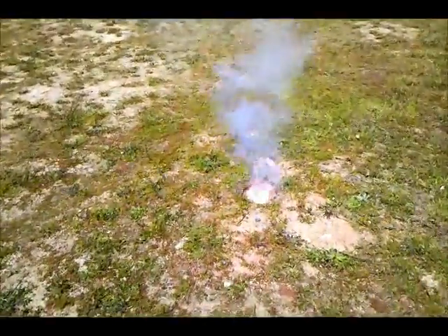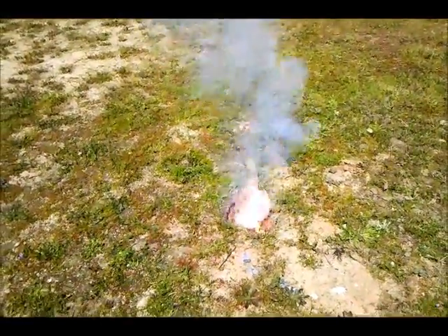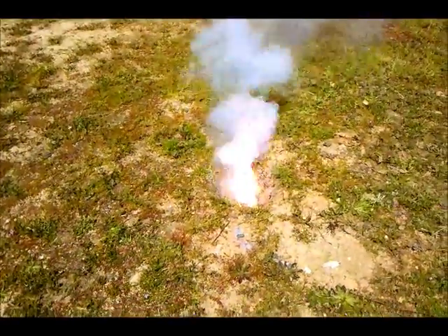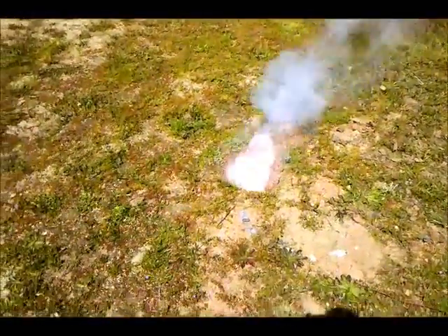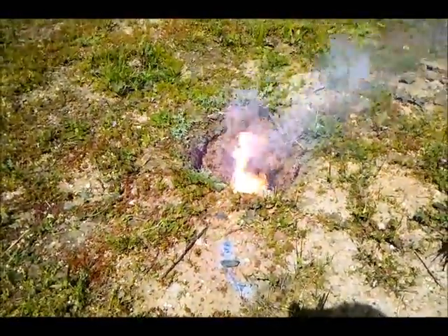I don't know how well it picks up on camera, but we can see a blue tint to the flame due to the presence of the sulfur there. It's getting really energetic. You can see the silicon product bubbling down there. And it's still reacting.